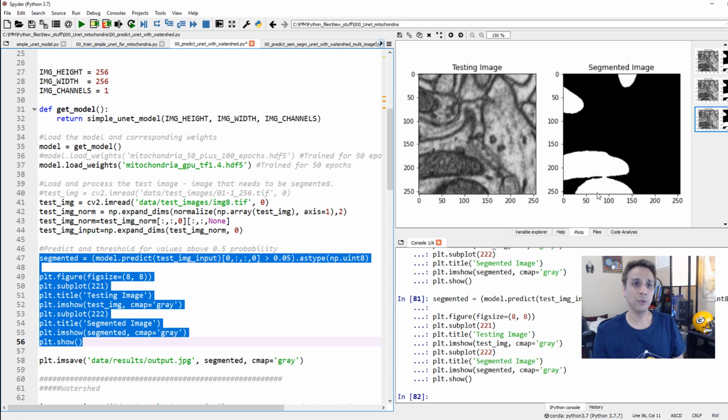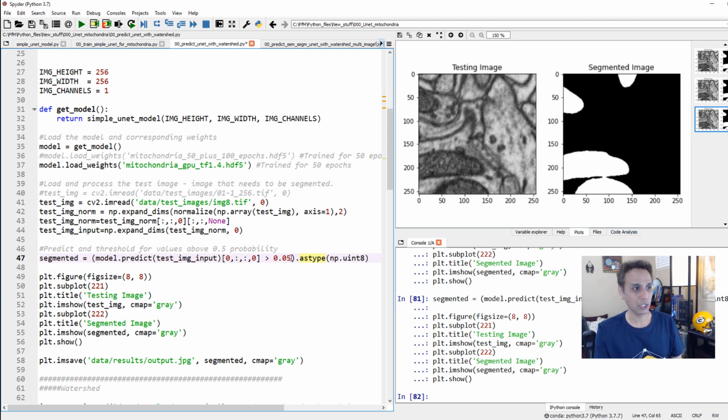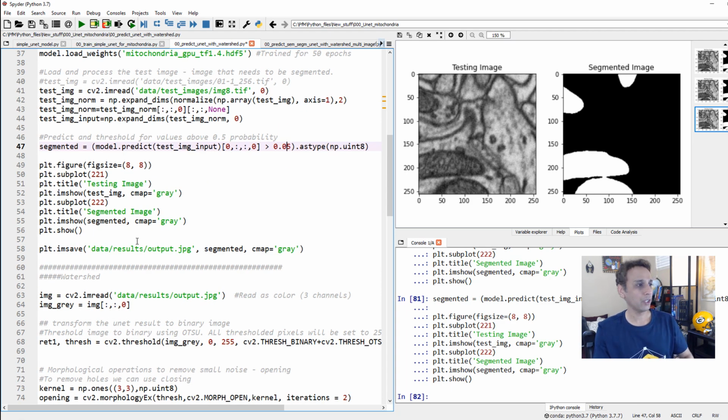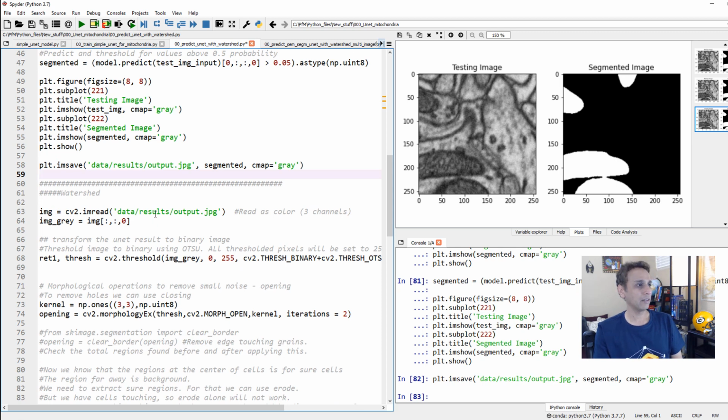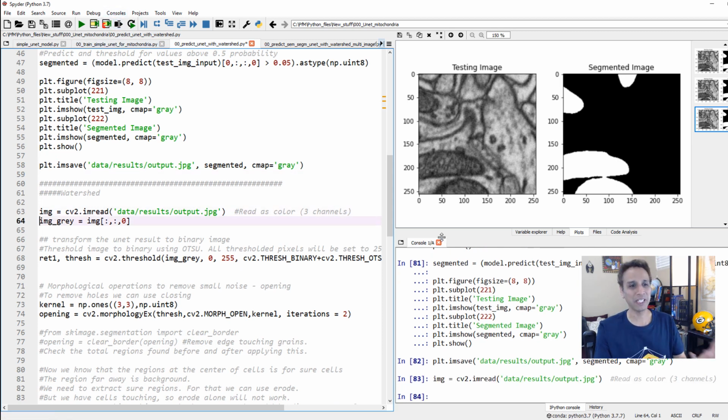One thing to note here is that this model is doing such an amazing job. Even if I put my threshold at 0.05 probability, the image still looks very nice and clean. If this were random forest, it would be completely crappy, and I've done that experiment already. So now we have our segmented image. Let's go ahead and save it to the disk so we can refer to it later. And here I'm saving it and importing it again.